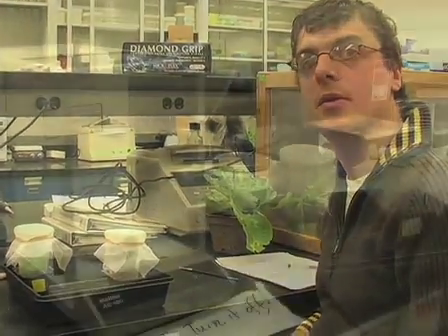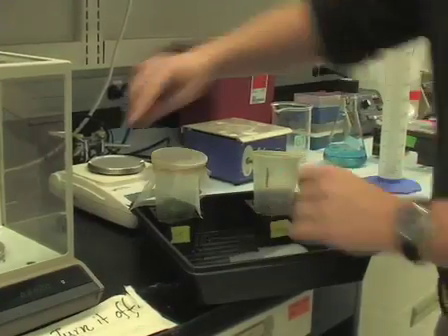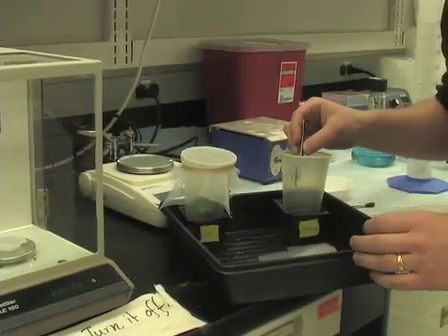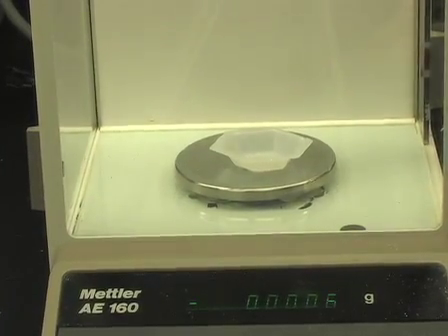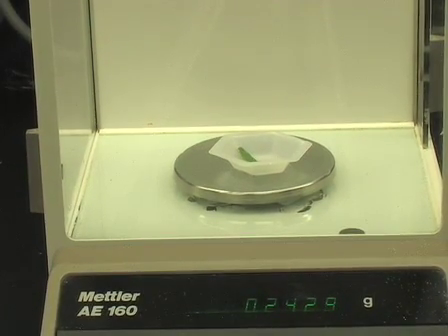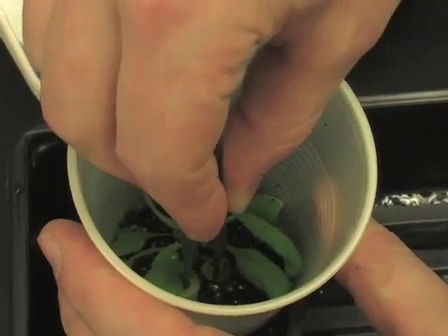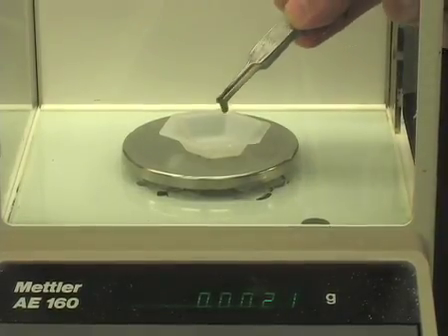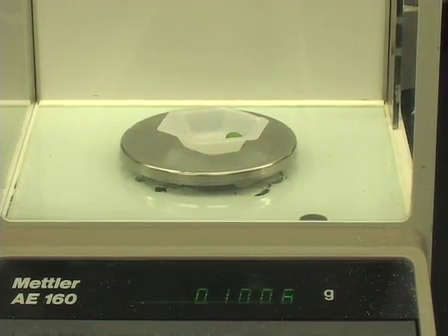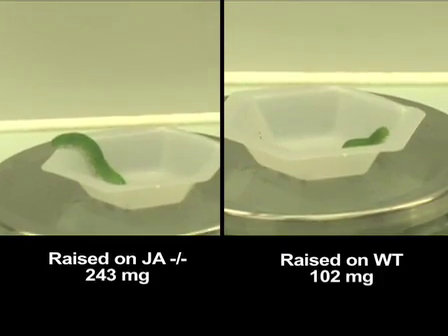We then wait usually seven days before we measure the larval weight gain. After seven days of feeding, we take out the larvae and weigh them on a scale. Using flexible forceps, I carefully pick up a larva and record its weight. This one almost weighs 250 milligrams — that larva was on the mutant plant. The caterpillar on the wild type plant only weighs about 100 milligrams. As you can immediately see, there's a lot more plant tissue left on the wild type plant, so there's a huge difference both in the amount of tissue eaten and the weight gain of the larvae.